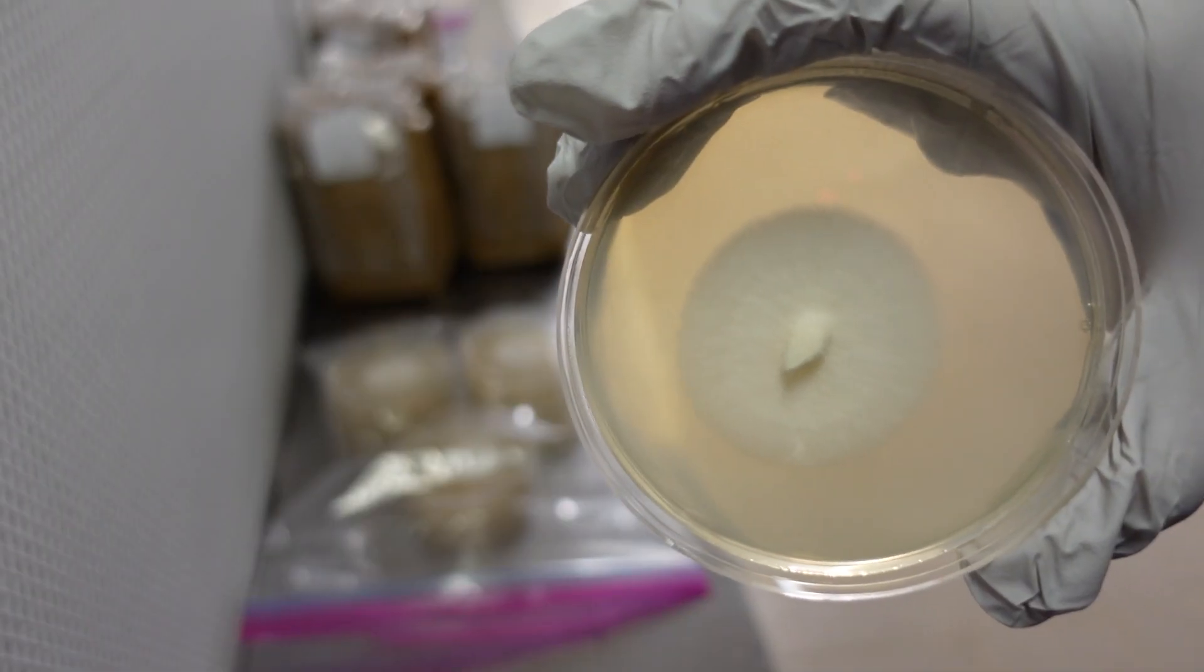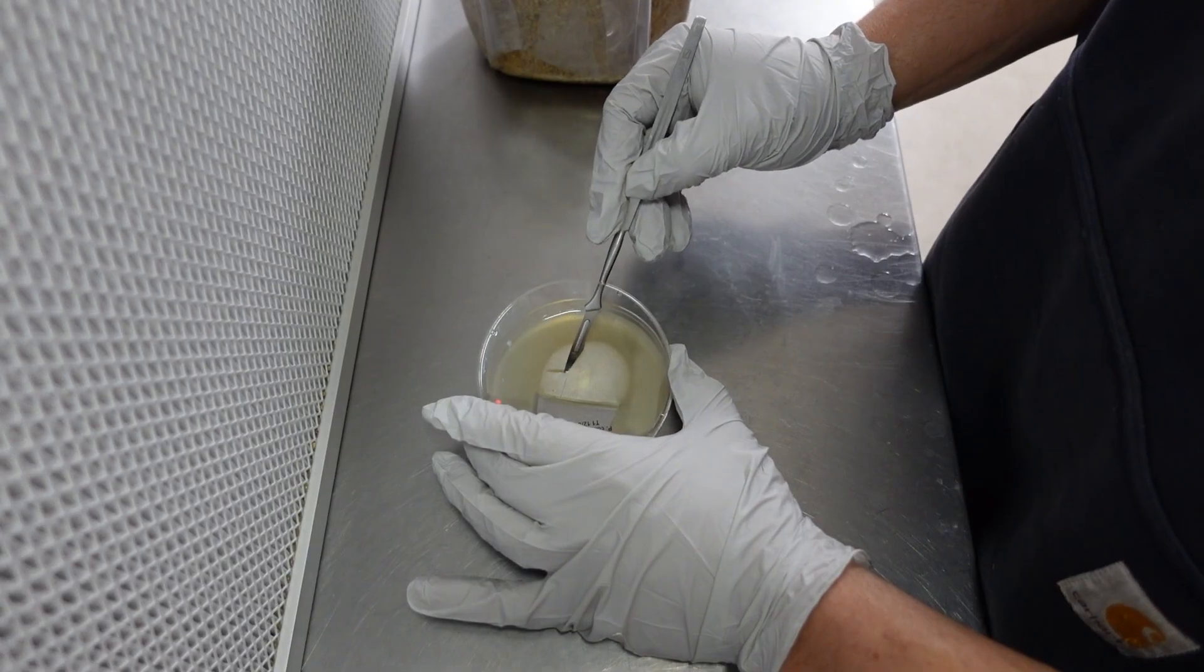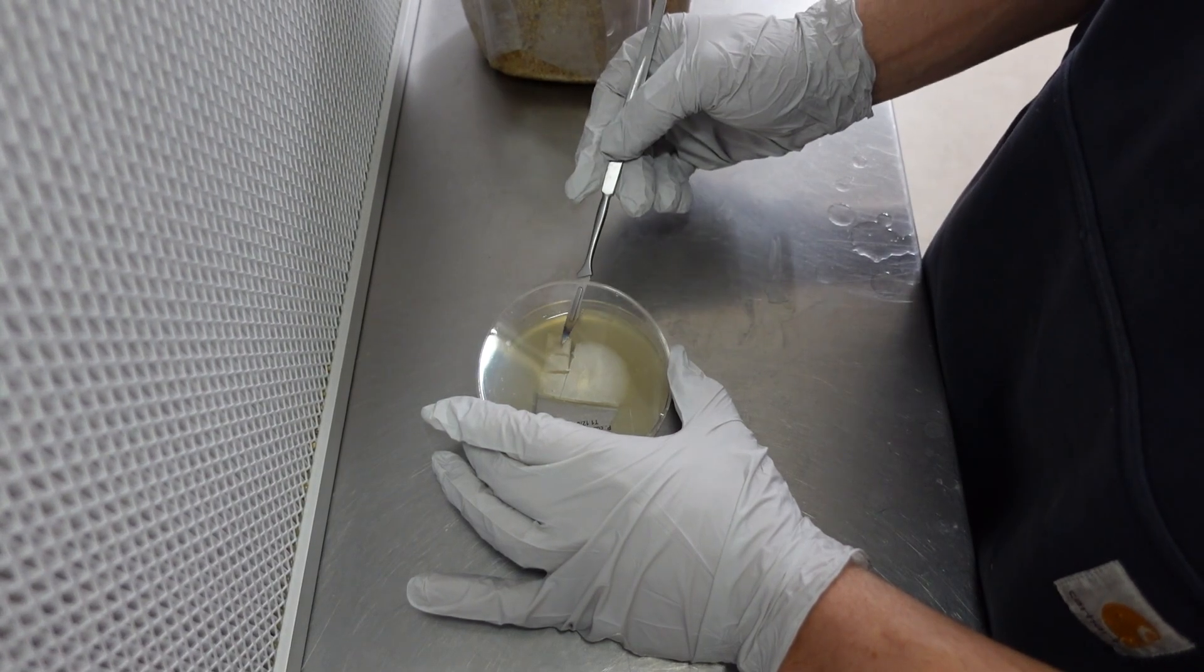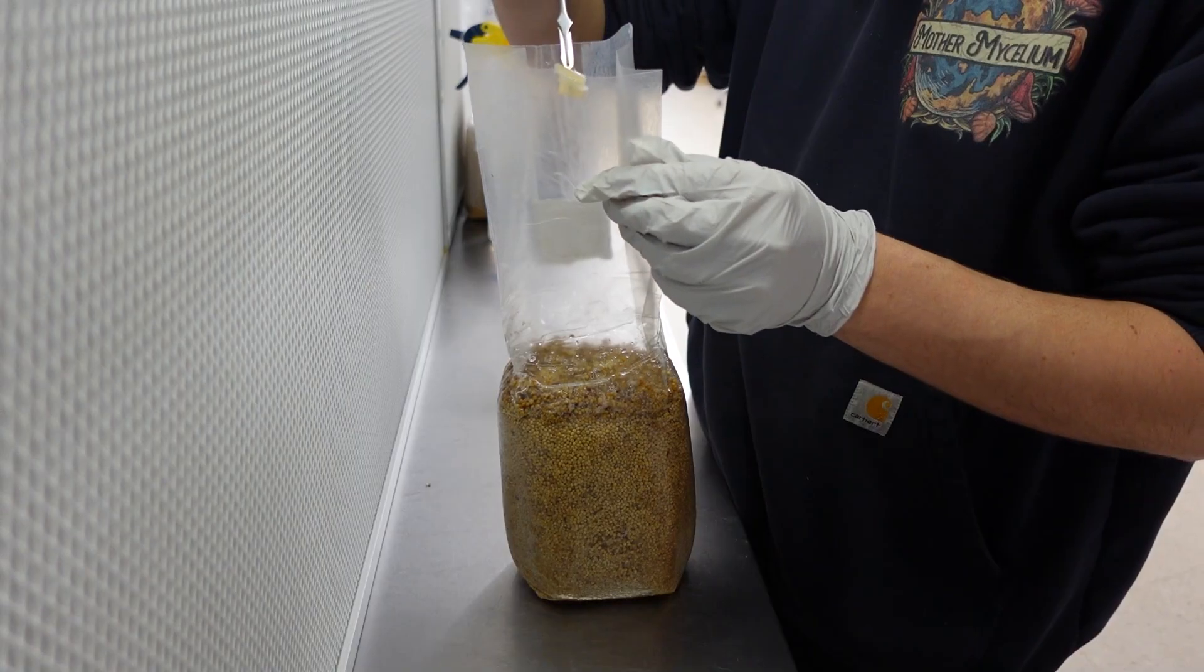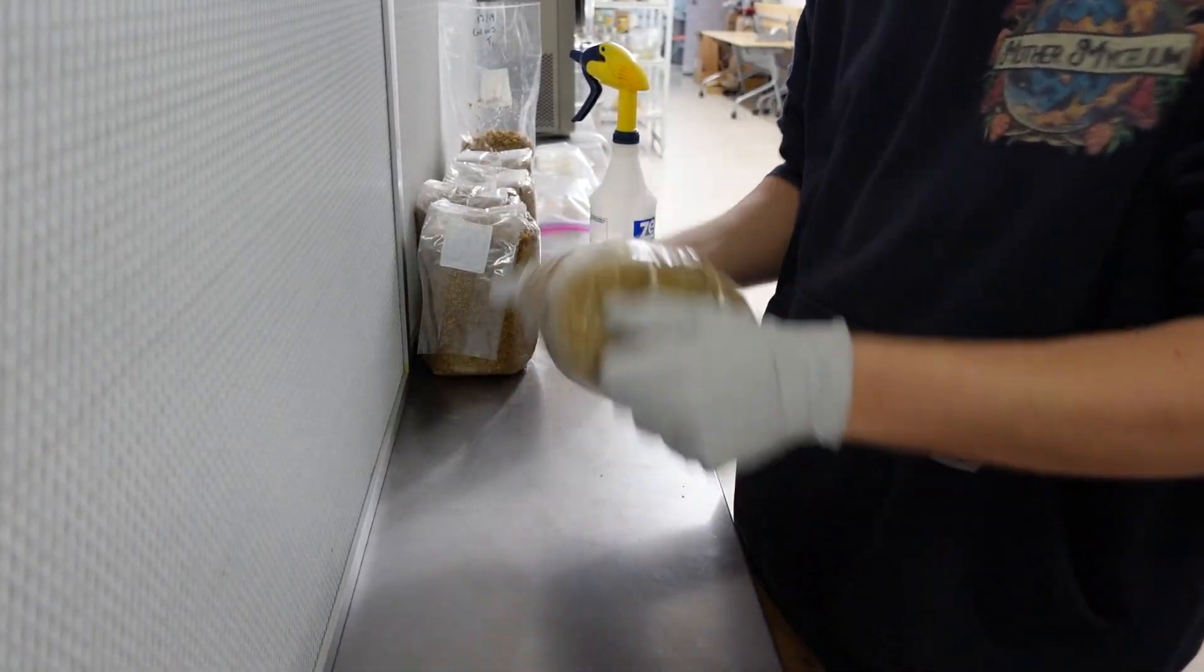Learning to grow mushrooms from spores is a valuable skill for cultivators that are looking for more genetic diversity in their culture libraries. When growing from spores, you can isolate your own strains and fine-tune cultures to suit your cultivation methods and goals.